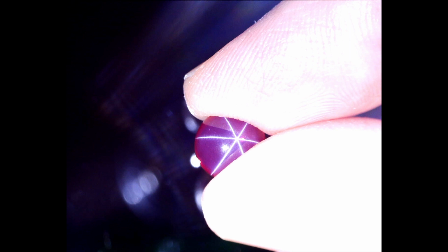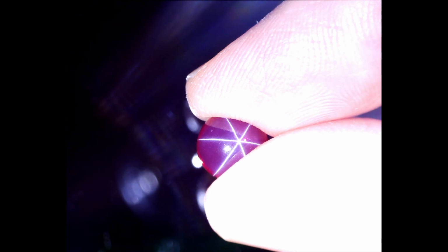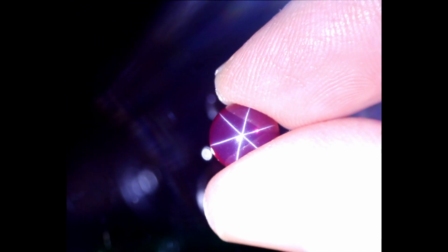Using our polariscope earlier, we oriented our star ruby so that we were looking down the optic axis and c-crystallographic axis of our star ruby. Now I want you to think about how the pattern of our asterism is related to that crystallographic orientation. And we'll explore this by rotating our star ruby around. Note that the pattern of scattered light that we see varies as we rotate our star ruby into different orientations.